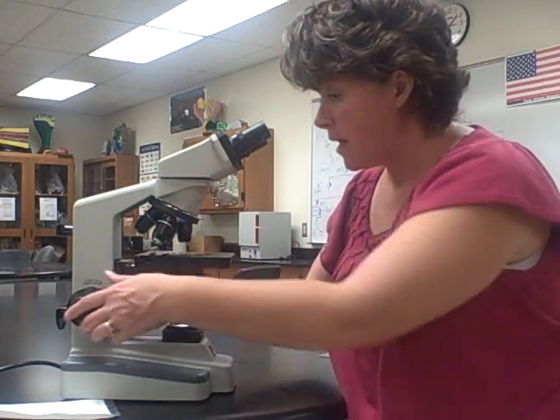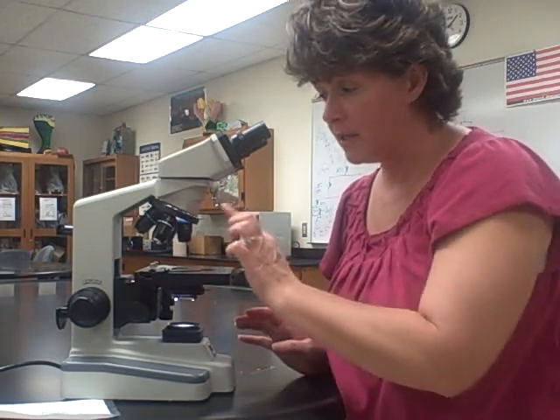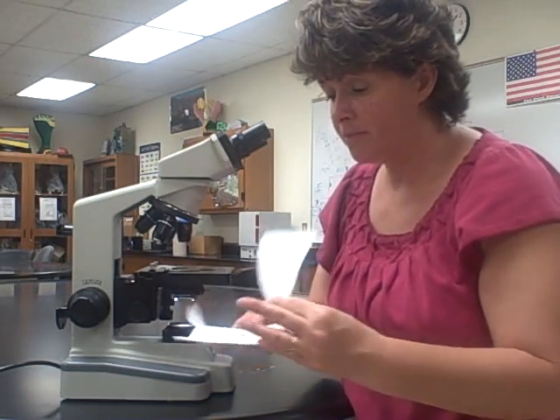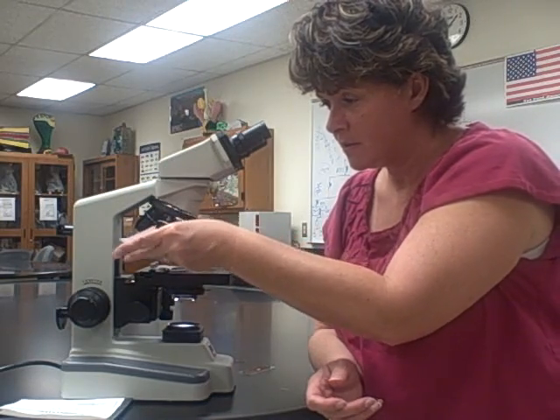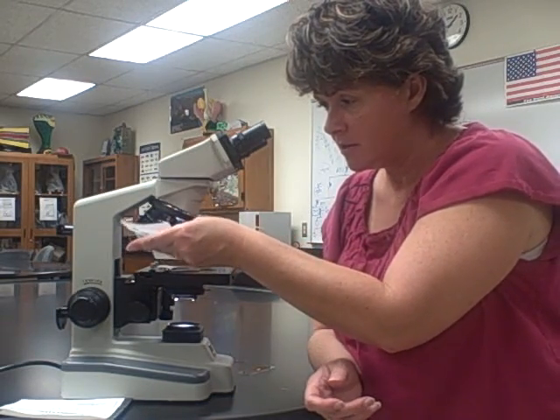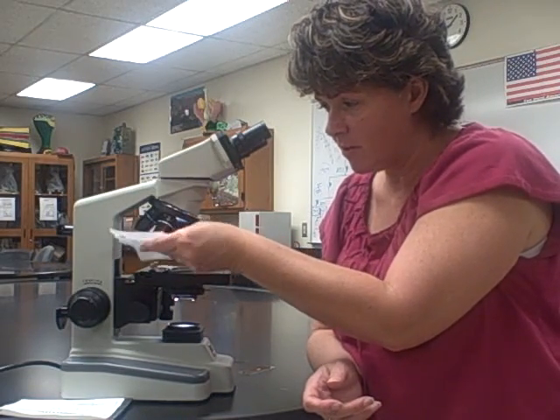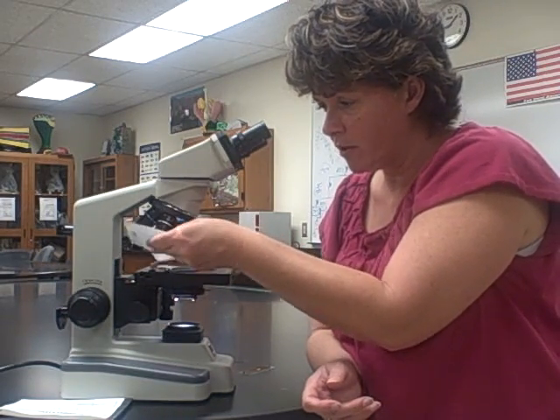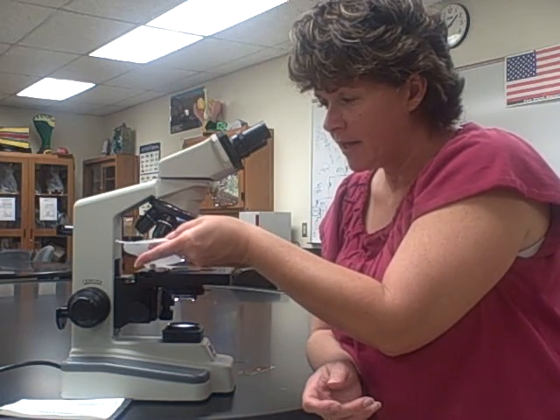Now that I've observed and drawn my specimen, I'm going to move to the 4x objective, move the stage down, and take my slide off. Once done, I need to clean the oil off the 100x objective using lens paper. You simply blot — each time a little more oil comes off — and you keep going until no more oil is left on that lens.